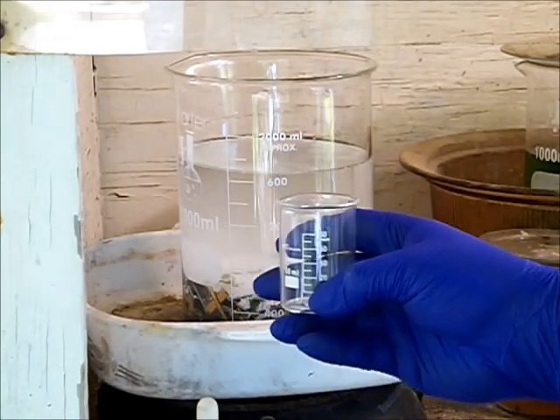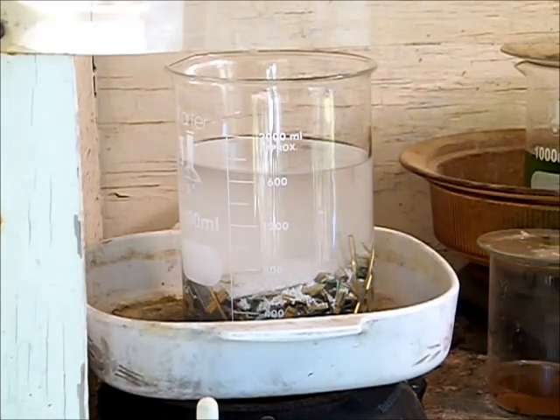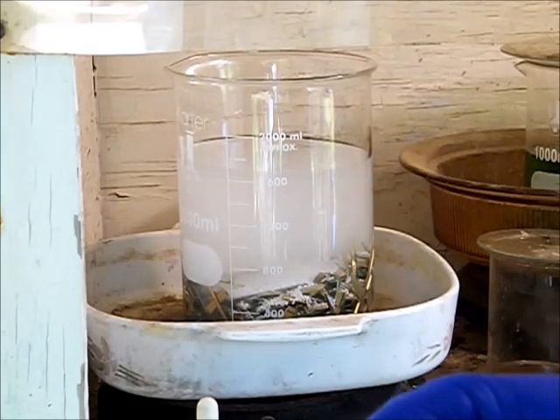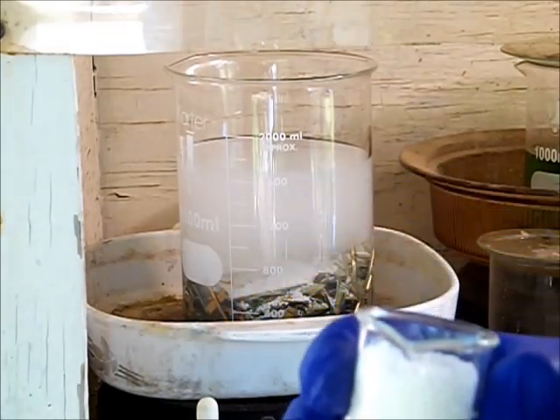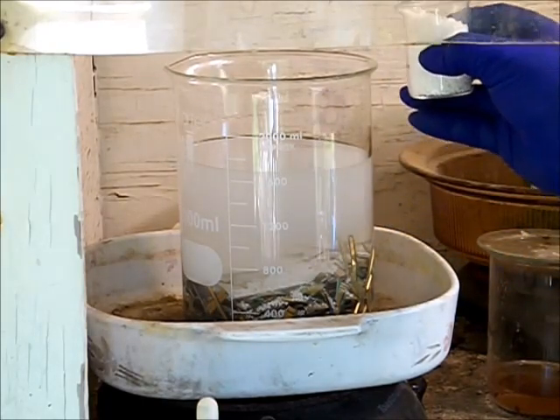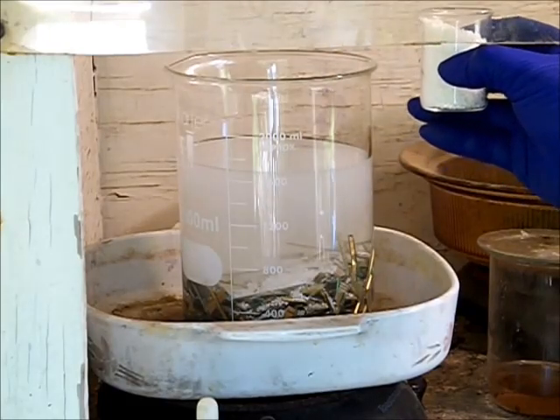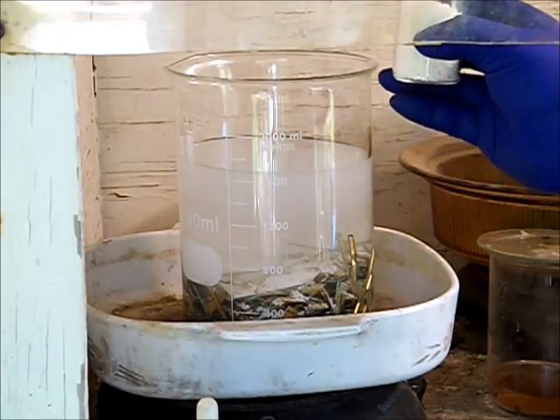This is a 50 ml beaker. For this amount, I go ahead and add a hundred mil volume of dry nitrate, so that'll be two of these beakers full. This is not exact measurements because I'm not really that good with chemistry, but this is what works for me. This is a lot of nitrate salt.